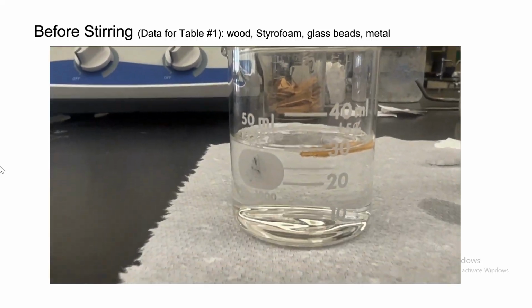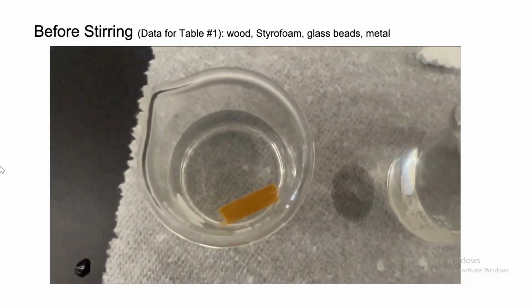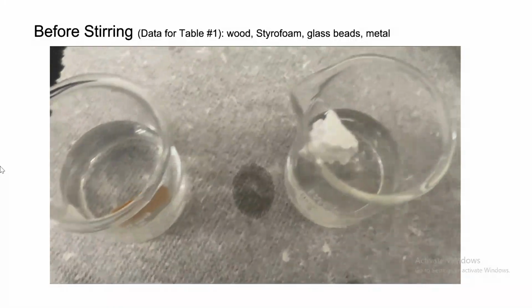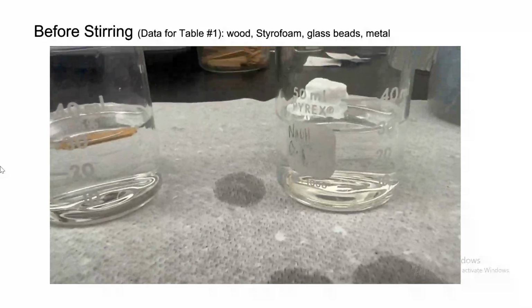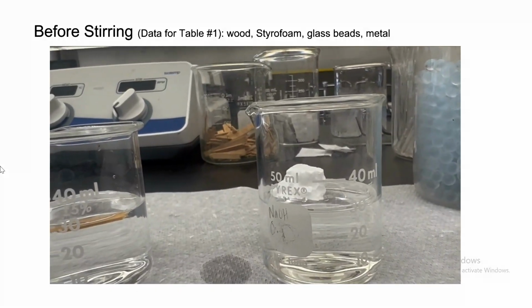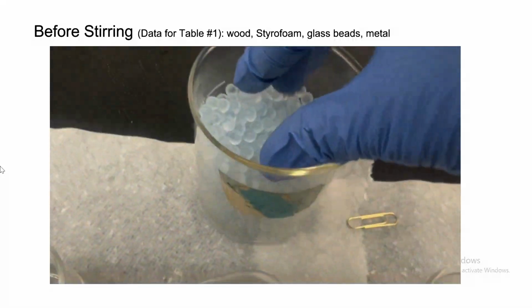So for observation, you're gonna write floats. And if it floats, is it more dense or less dense? That means it's, yes, less dense. Very good. Next up, the styrofoam. Styrofoam, as you can see, is it sinking or is it floating? It is floating in water, so that means it's less dense.